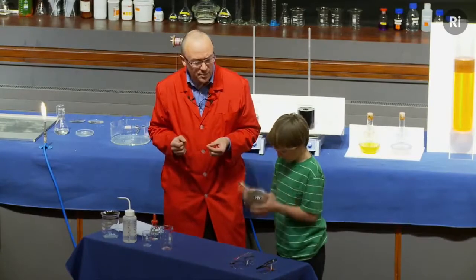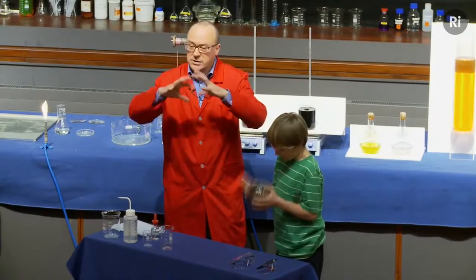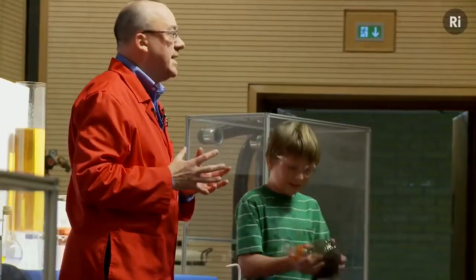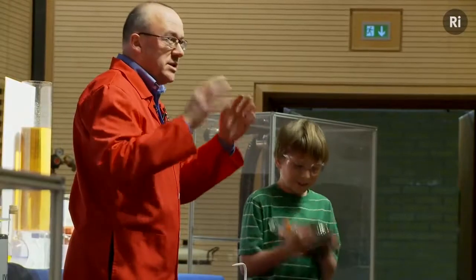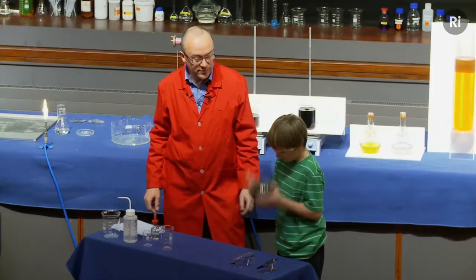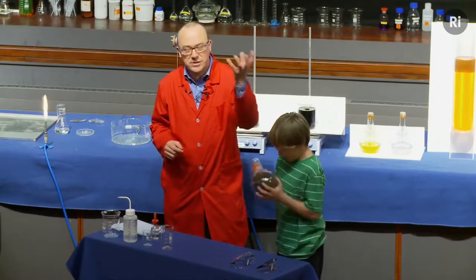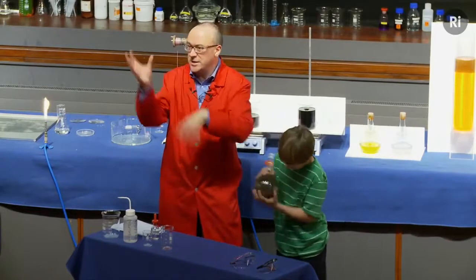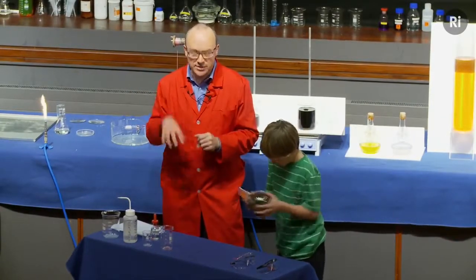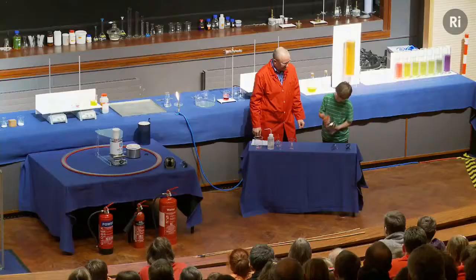What we're hoping is going to happen over the next minute or so is that those particles of silver will start to stick to the walls of the flask. And as they build up, we should see silver metal in the form of a mirror building up on the inside of the flask. And you'll all have seen those decorations that you get at Christmas, those spheres that are shiny, and they're made using this chemical reaction. The little balls of glass, and the inside is coated with silver using this kind of chemistry.